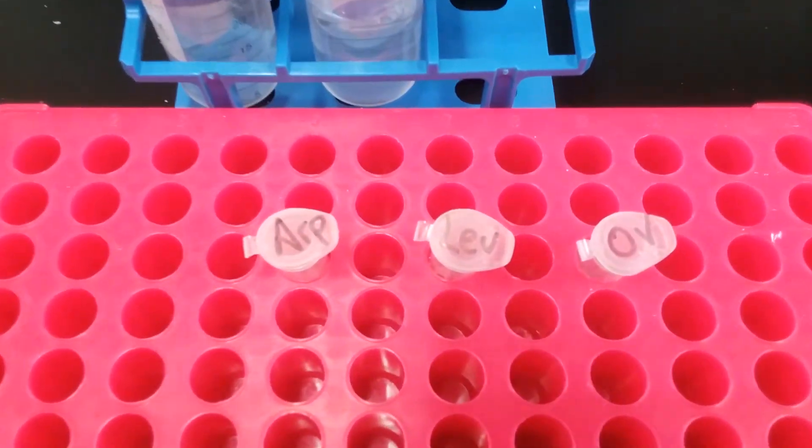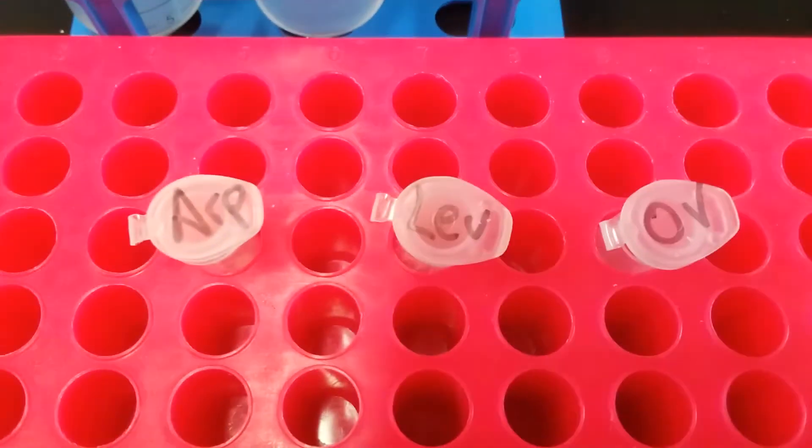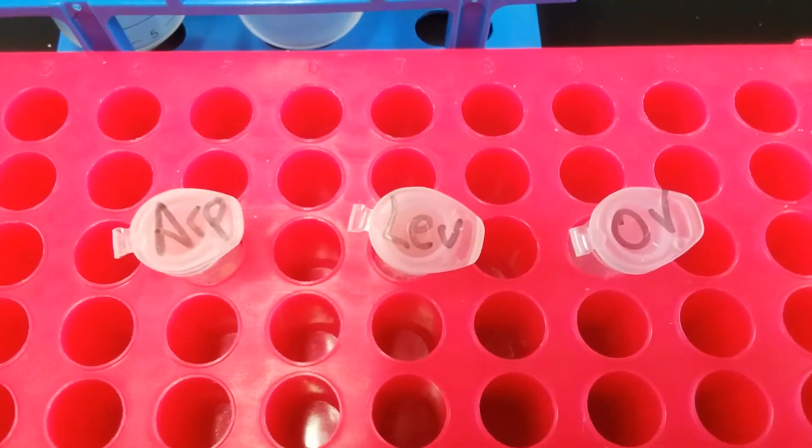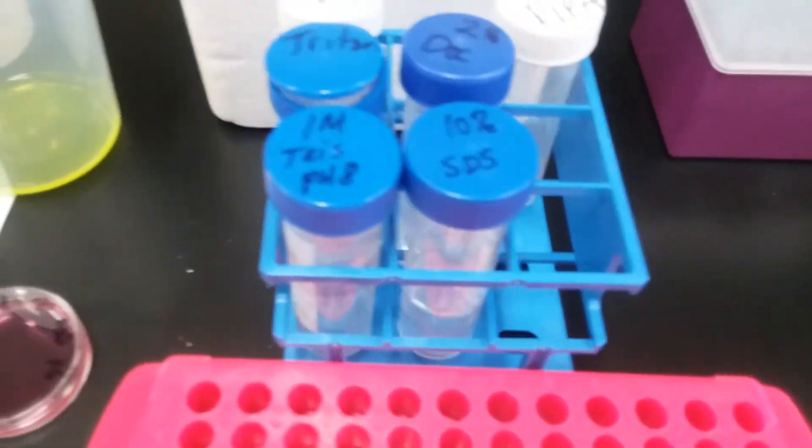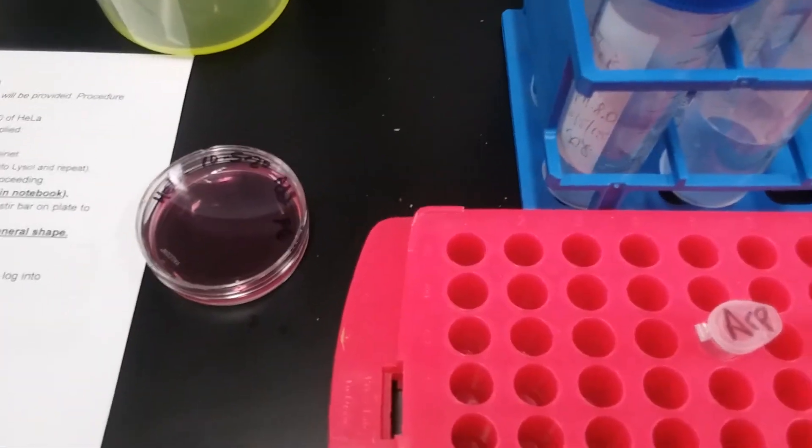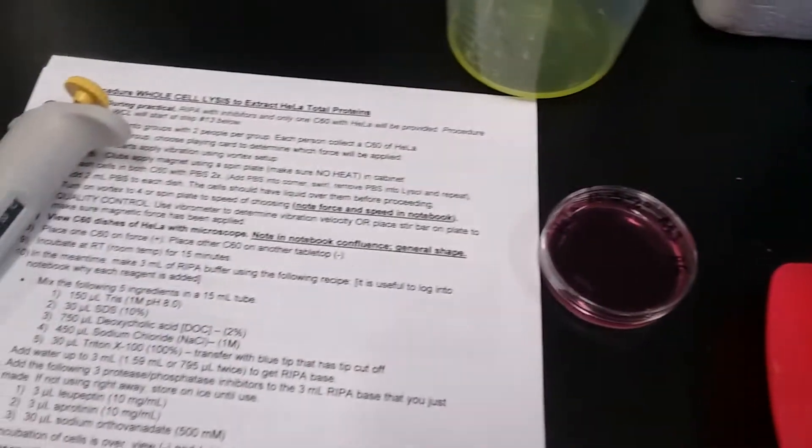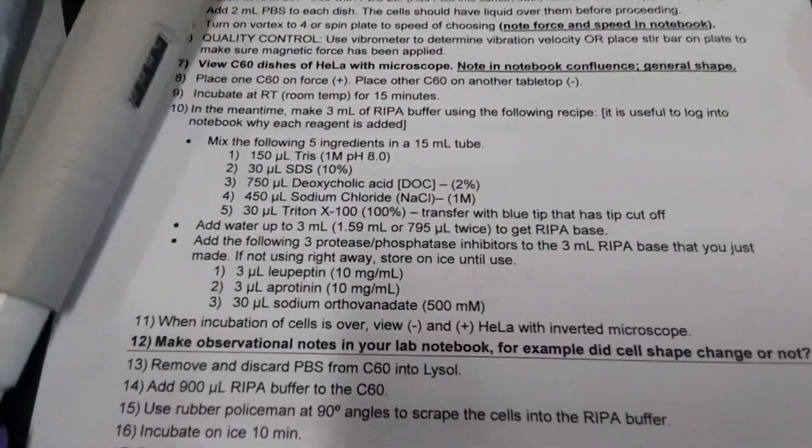And then we will add our peptidase and phosphatase inhibitors because we don't want our total proteins that we're harvesting from our whole cell lysate being eaten by these enzymes.